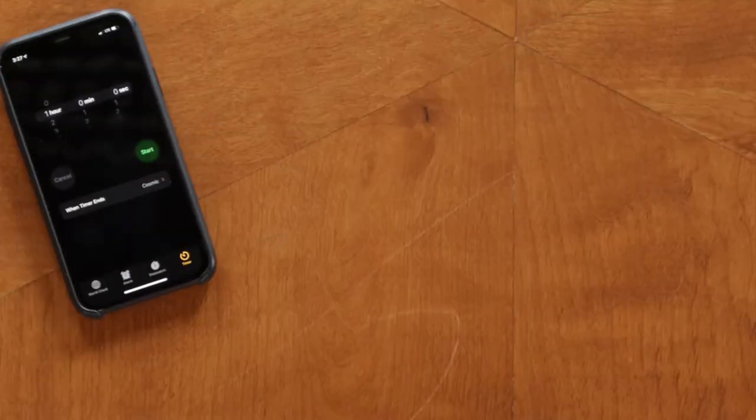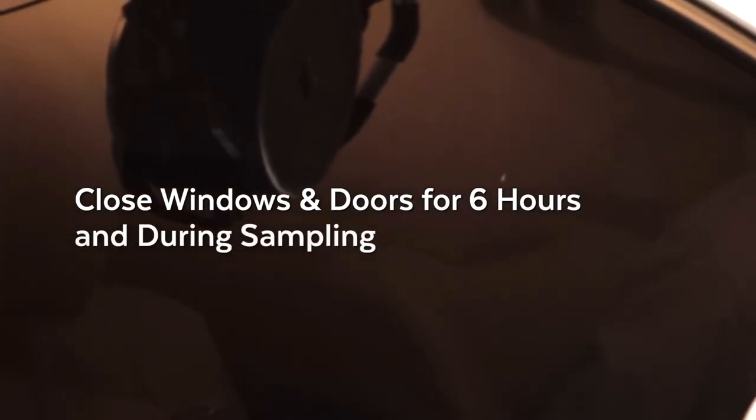Sampling Vehicles. To test your car or truck, you'll also use a mold testing plate. Before you sample, keep doors and windows closed for six hours. Then, during sampling, keep those closed as well, other than entering or exiting your vehicle. Enter the vehicle and place the mold testing plate on a paper towel on the front passenger seat or center console. Now, turn on your engine and let the air conditioner or heater blow for 30 minutes on recirculate, which is labeled max in some vehicles. Then, turn off the car and let the plate sit for another 30 minutes.